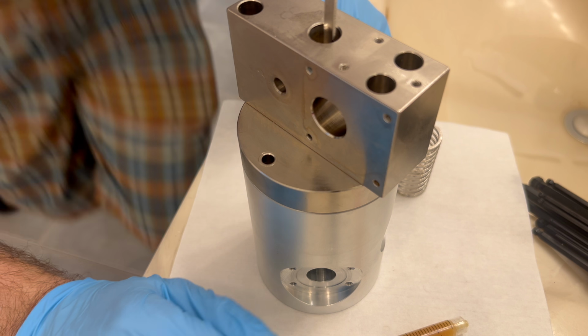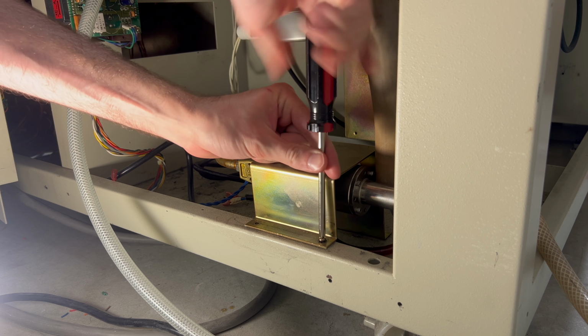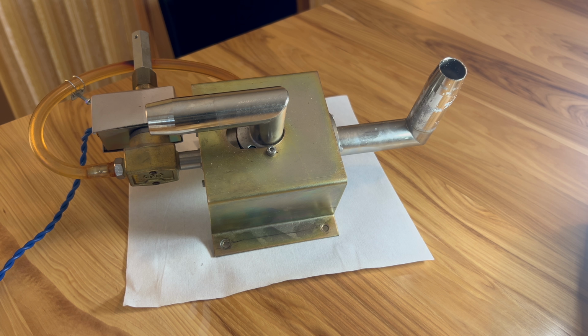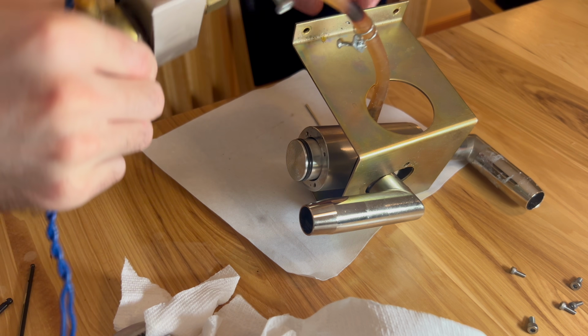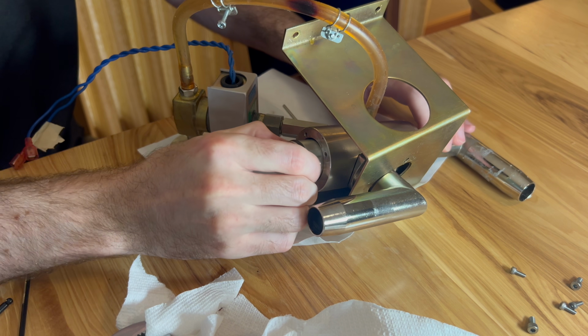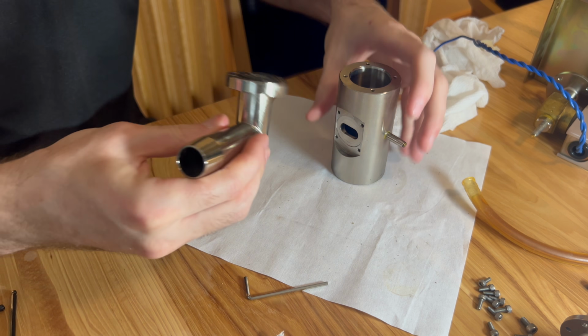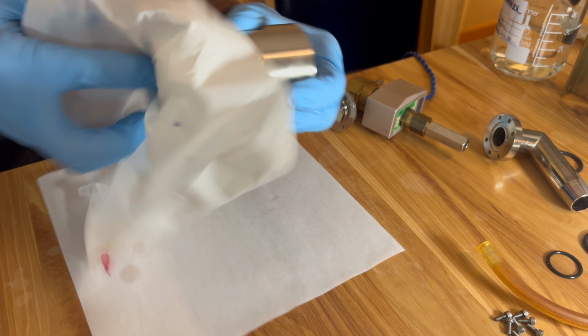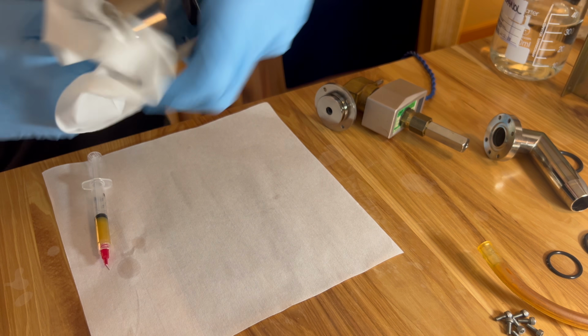Thanks, Martin. Since the vacuum system is apart already, I'm also going to recondition the RP vent valve. This small valve on the bottom is a protection valve that isolates the entire SEM from the roughing pump. This protects the diffusion pump from atmospheric pressure in case a power outage or other failure causes the rotary pump to stop working. Same as before, I cleaned it with acetone and isopropanol and lubed it with Apiezon-L grease.